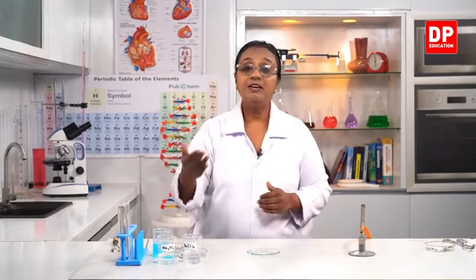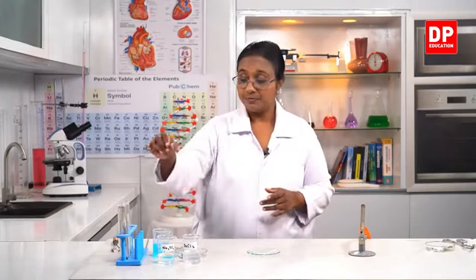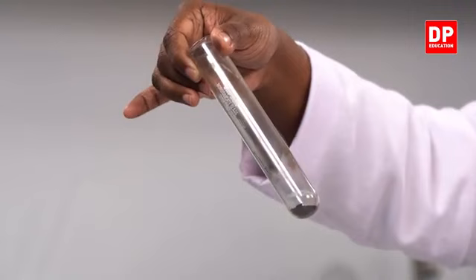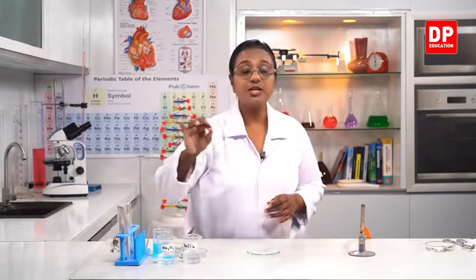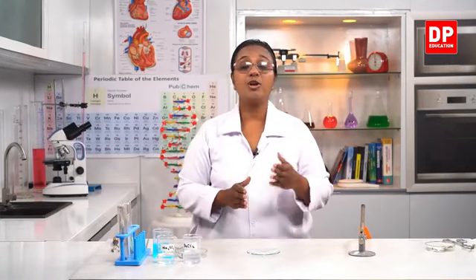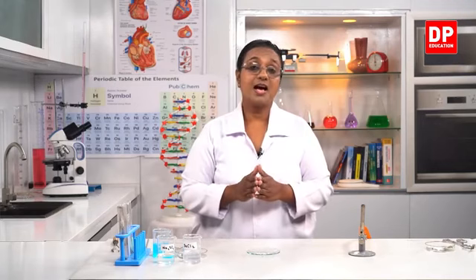Then the second reaction, I don't have the products here. We used potassium permanganate, one reactant giving rise to 2 or more products. I told you all potassium manganate, manganese dioxide and oxygen gas were evolved. You were able to see that. The potassium manganate and manganese dioxide remained in the boiling tube, and we used the glowing splinter to observe the evolving of oxygen gas. So from one reactant, 2 or more products are formed, and those types of reactions are known as chemical decomposition reactions.